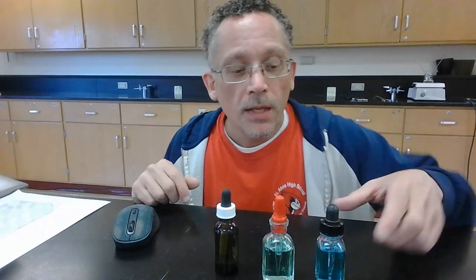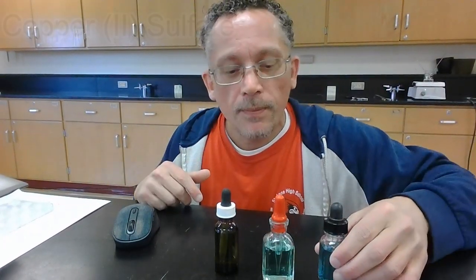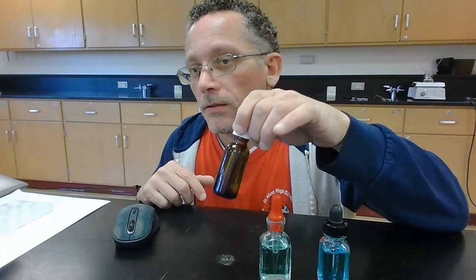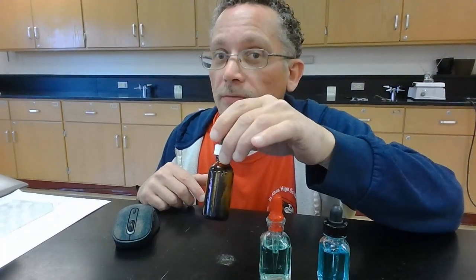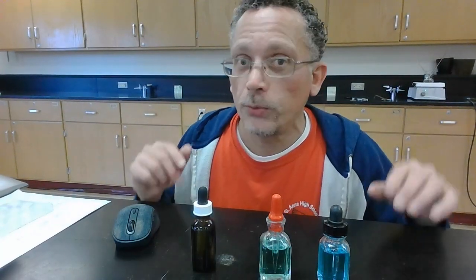Let's go check out our different compounds here. All right, so for the first part of this activity, we're going to look at copper 2 ions and nickel 2 ions. Here I have a compound. This is copper 2 sulfate. This is nickel 2 nitrate. And this is the mystery compound. We're going to try to identify whether this contains copper 2 ions or nickel 2 ions, right?